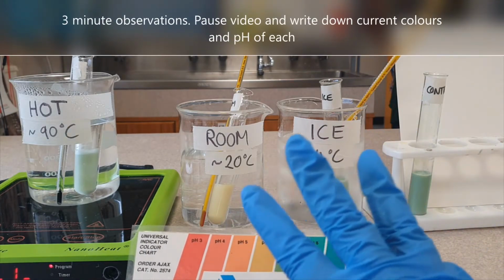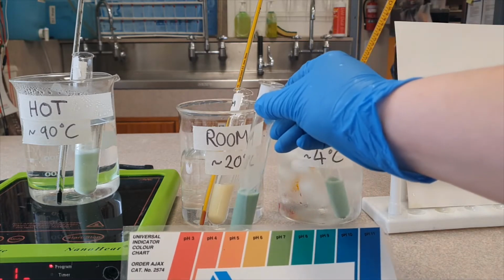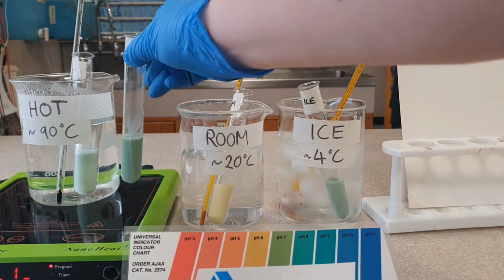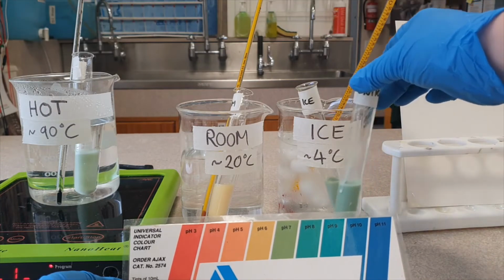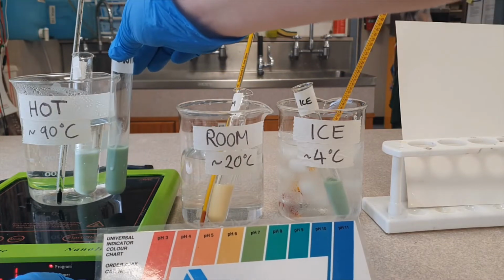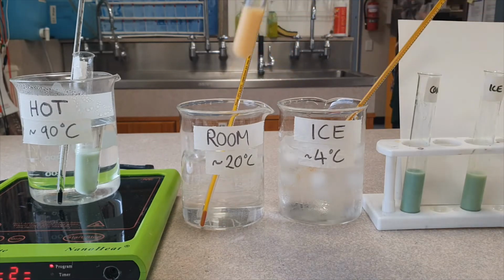Okay, so it's been 3 minutes now. Let's look at each one and compare it with the control. Can you see any changes? It's been 4 minutes now. Can you see any differences? What are you noticing? Okay, so it's been 10 minutes. So I'm going to stop the reaction and pull all of these out.